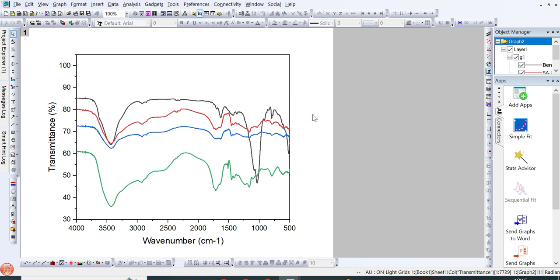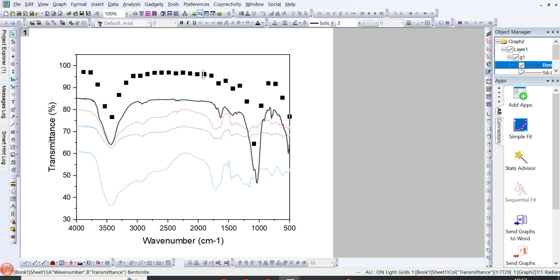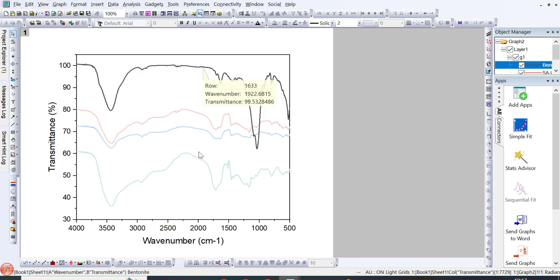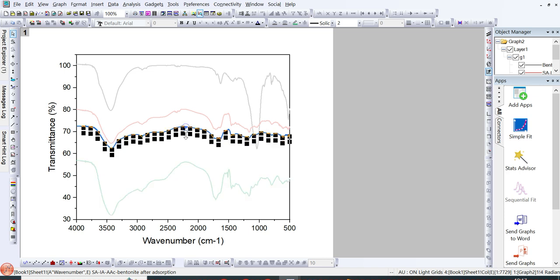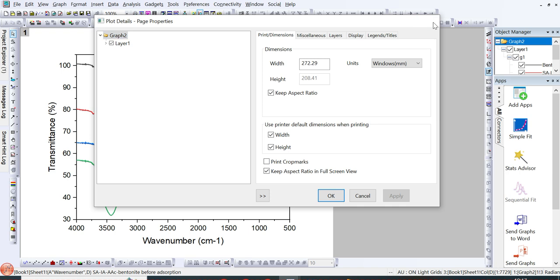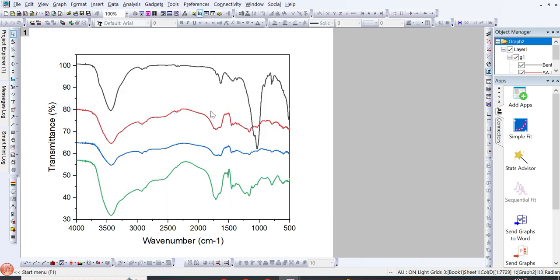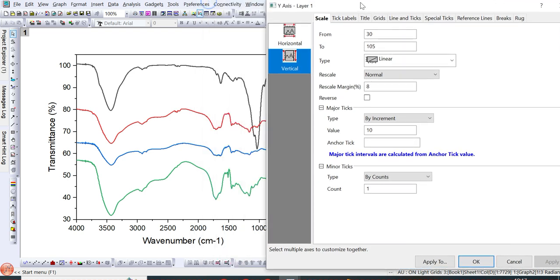Now after selecting Individual and clicking OK, you can easily drag the lines up and down. For example, if I want to move this black line up, I can just click on it and drag it easily to the upside, and in the same way I can drag this line down, and this blue line, to keep some distance between the lines. Here you can see this line is still overlapping or merging with these lines, so I can make this axis scale much wider, so that each line can get equal spacing, and it looks more attractive as compared to the overlapping trend.